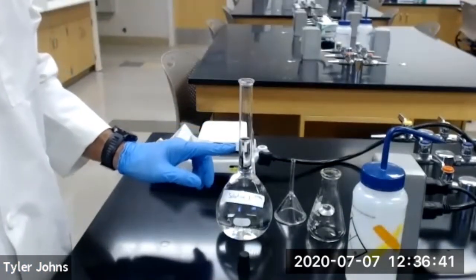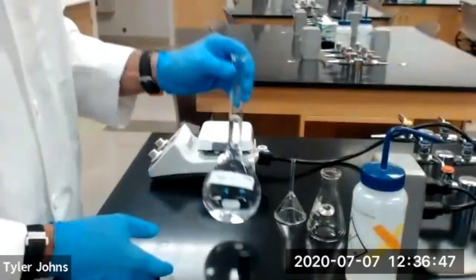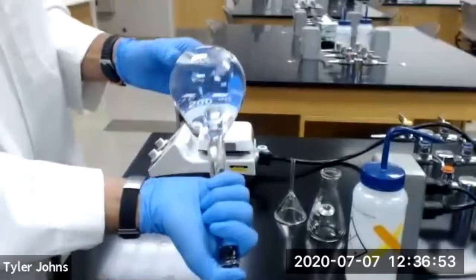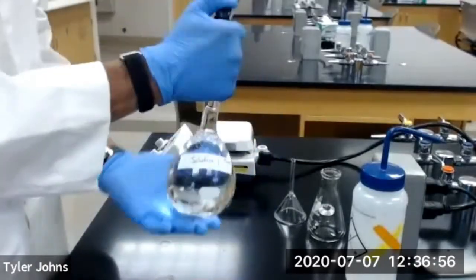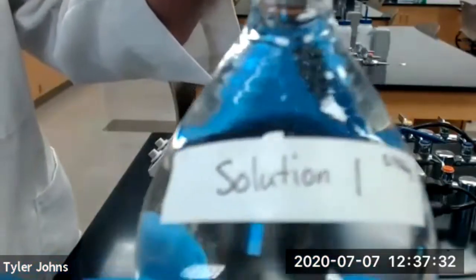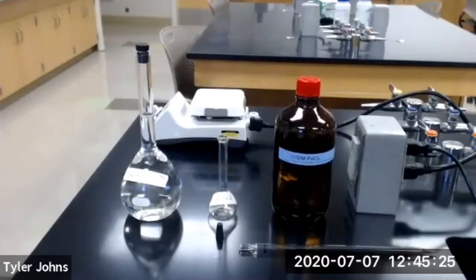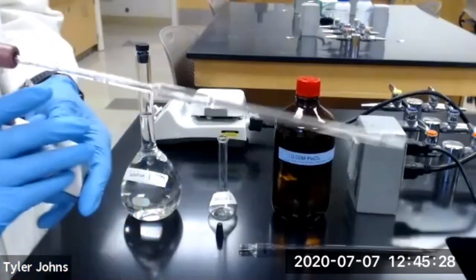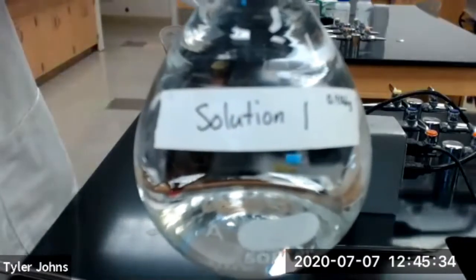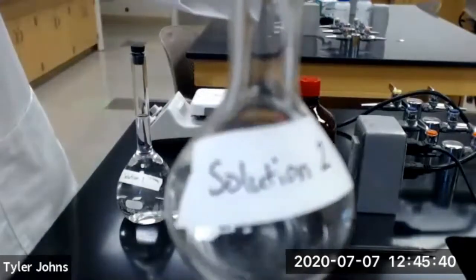Once we have filled our 500 milliliter volumetric flask to the line with deionized water, we're going to stopper our flask and invert to mix at least 10 times. And we're going to label this flask as solution number 1. Next, we're going to use a 5 milliliter pipette to transfer 5.0 milliliters of our solution number 1 to a new 50 ml volumetric flask labeled solution number 2.